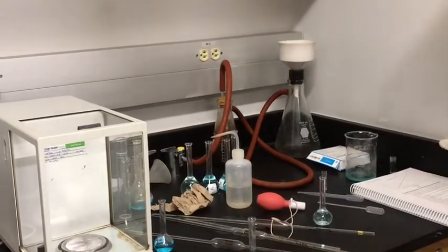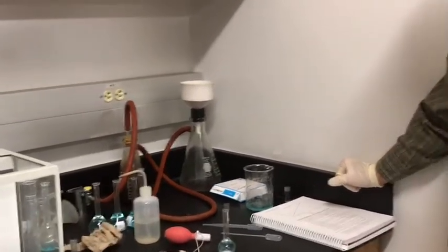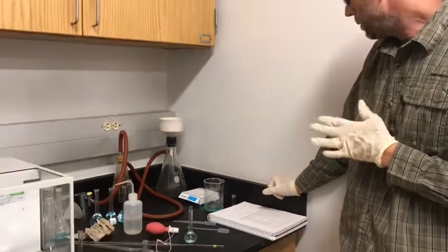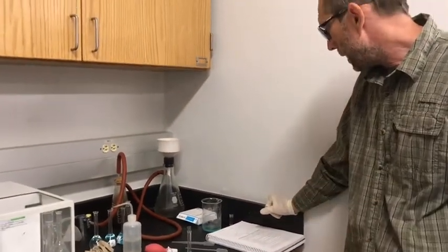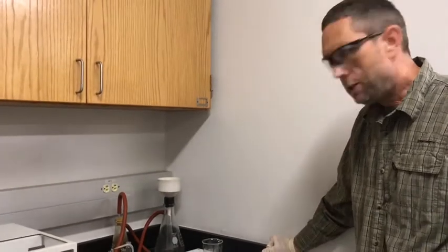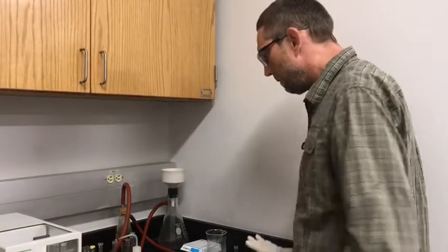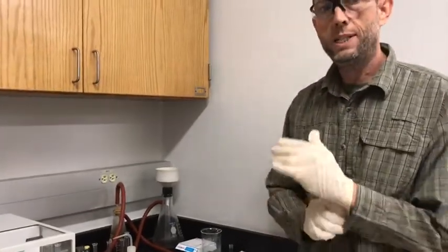And that is it for the experimental procedure of this. You will be doing calculations. You'll graph the results you got in part B and then use data from that to figure out your molarities for part C and so on. But that is it for the experimental part of this procedure.